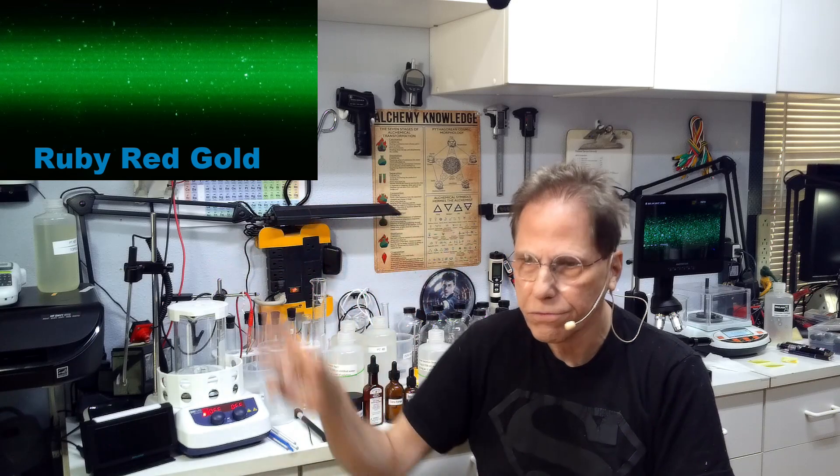It's got that band in there where we can't really determine the size of the particles. And I think if we were able to cook platinum a little bit further from 6 parts per million to 12 parts per million, we would see the same sort of thing going on. These little tiny particles would get so close together they would look like a giant solid wisp. But I'm not able to cook with this formula. You're not going to be able to cook it to 12 parts per million. So maybe down the road when I get a more efficient formula together and stuff like that, we can see that. Anyway, that's going to finish the beginning, start to finish part one for you here.